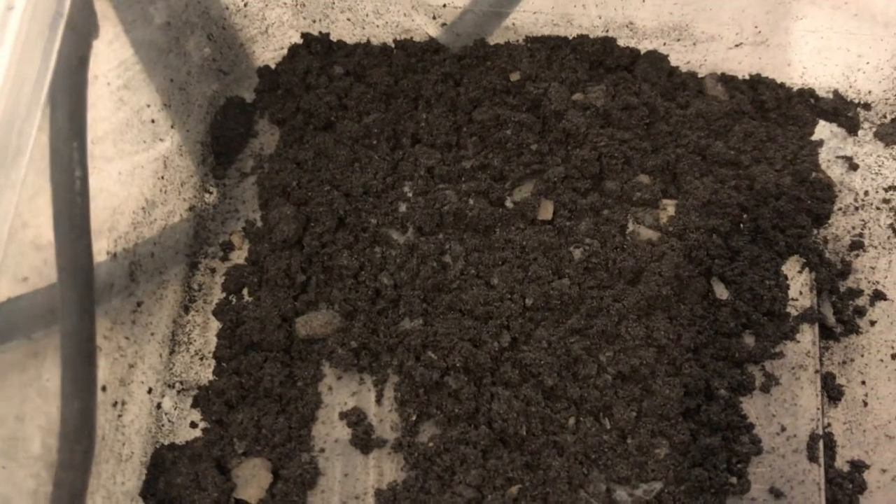I didn't get great expansion on the 96% graphite — I think the particle size was too small, around 30 to 50 microns. It did expand a bit, and that's part of the filter paper there. This one needs washing again and checking its pH until it's neutral. I'll try a few more samples and see what happens, and then I might try to concentrate the acid again — though I'm pretty sure it's already quite concentrated and it's just the particle size. Then I'll do a resistance test on these powders.